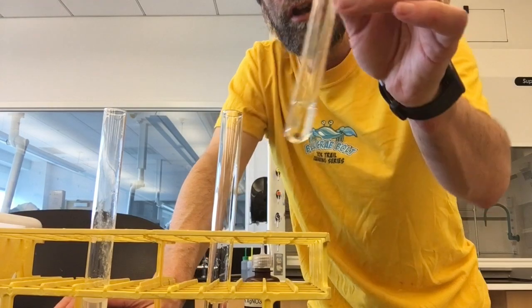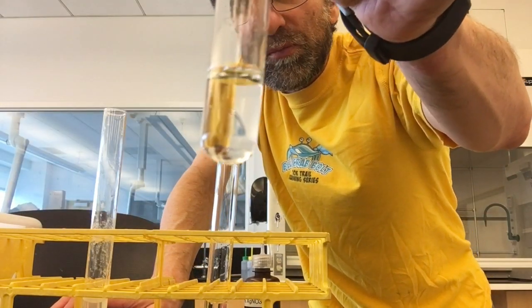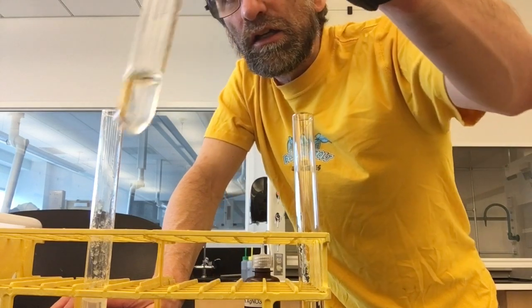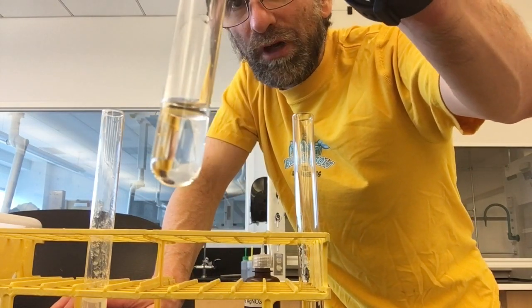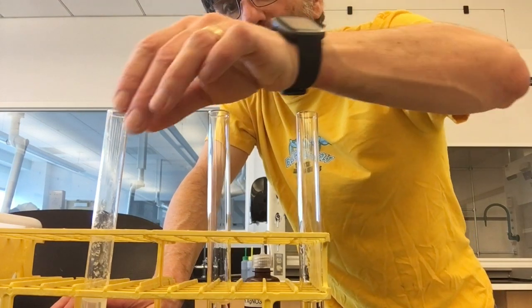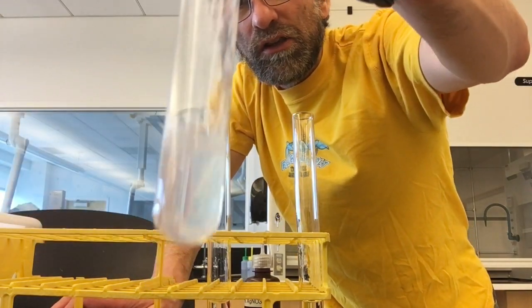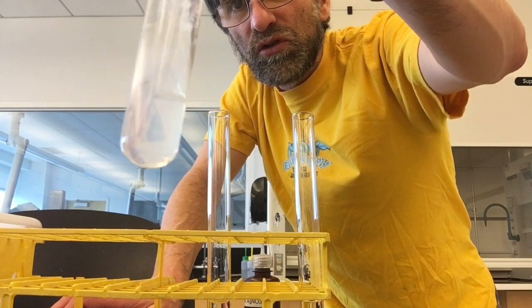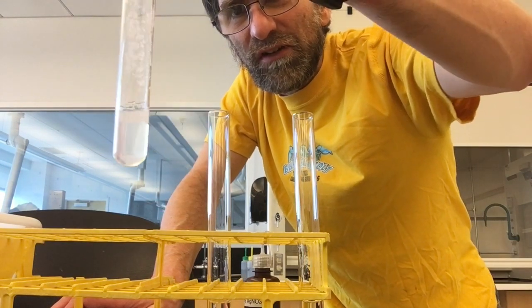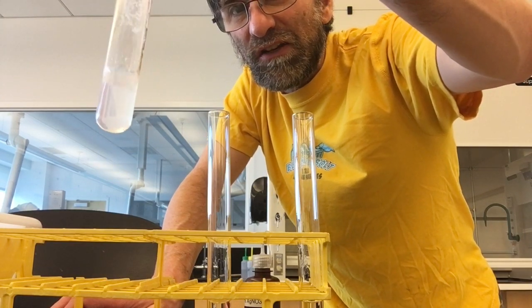I want you to notice that the methyl chloride — there's no precipitate there. The chloroheptane, the primary compound — there's no precipitate there. But instantaneously, if you look, the t-butyl chloride is cloudy. That's the indication of the formation of a precipitate, and it happens instantaneously.